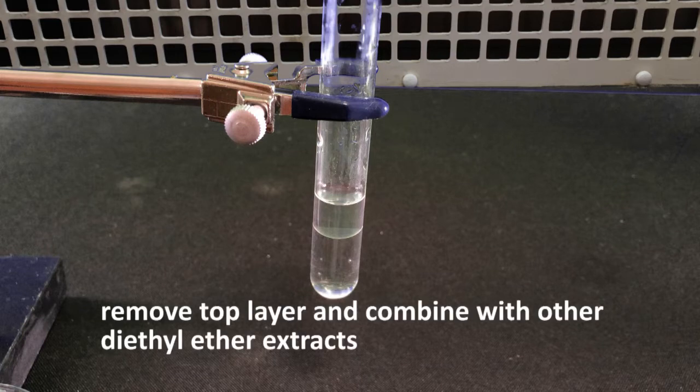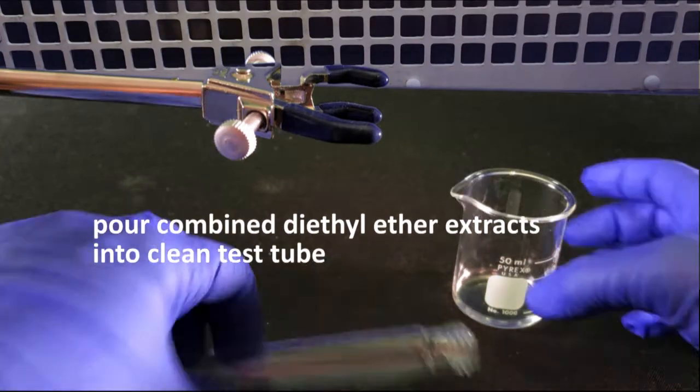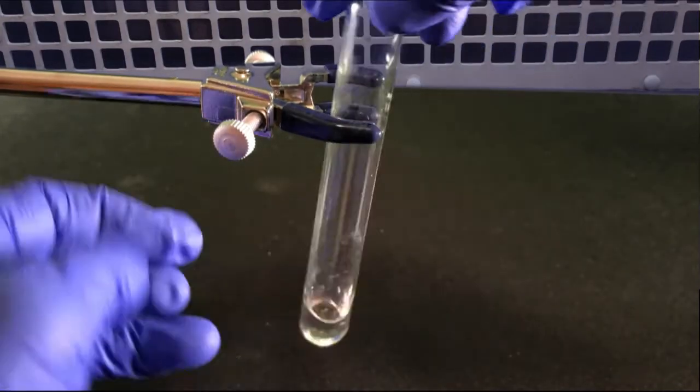However, since this is a new technique for you, it would be good to write these details in your notebook. Once the extraction is complete and the organic diethyl ether layers have been combined, you want to wash this with approximately 2 ml brine. Transfer the organics into a clean screw cap test tube, then add the brine. Shake, vent, and let the layers separate.